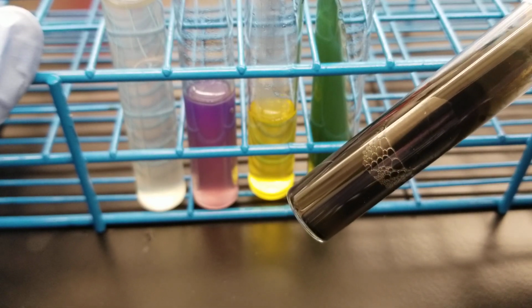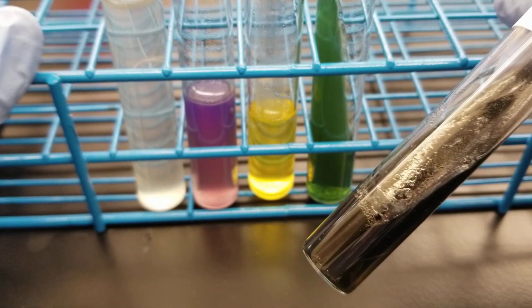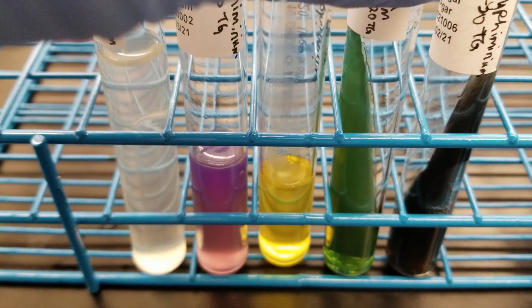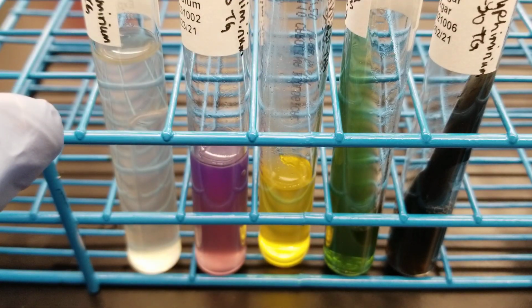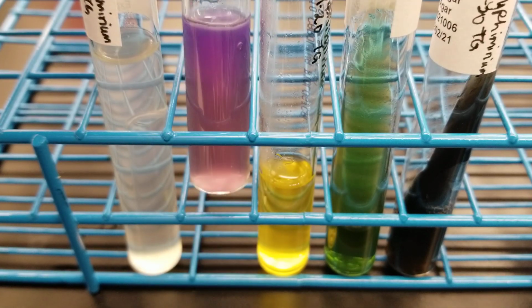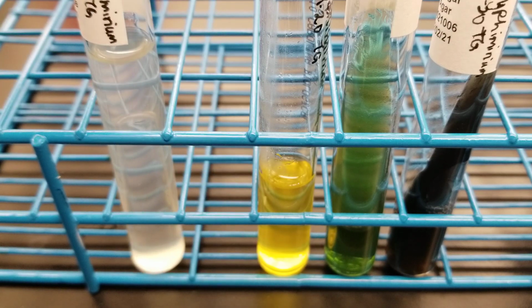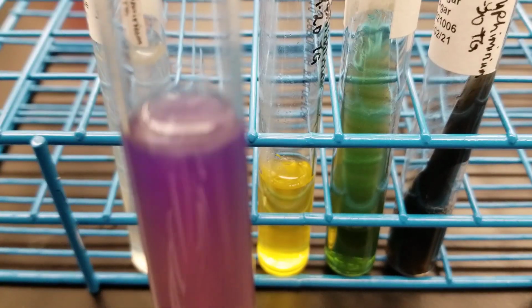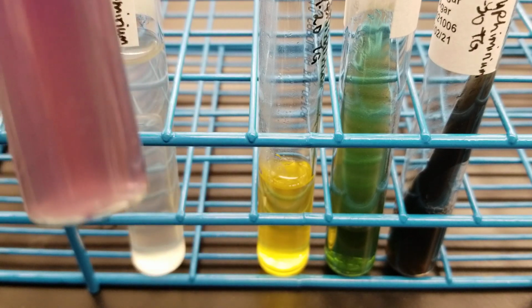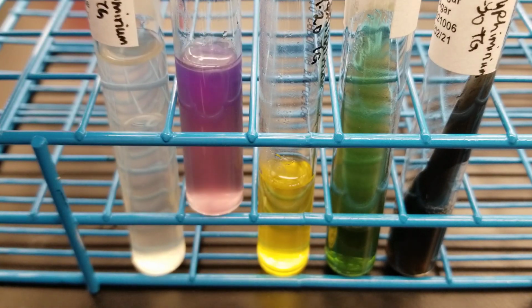But you can see there is gas production in this one, and it has to have been acid on both the butt and the slant. So there we are with that. We have a citrate negative right here. It's urease negative. It looks very, very cloudy in this MIO tube, but from what I can tell, that's just the motility. There's so much growth in there you can't even see the stab line or anything, so it's very motile.